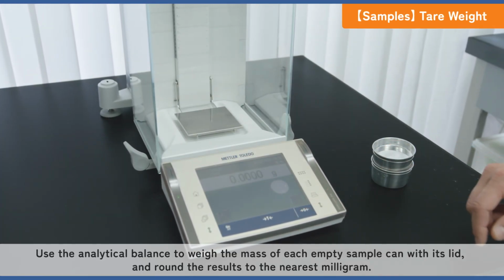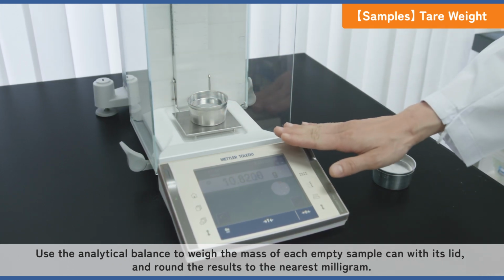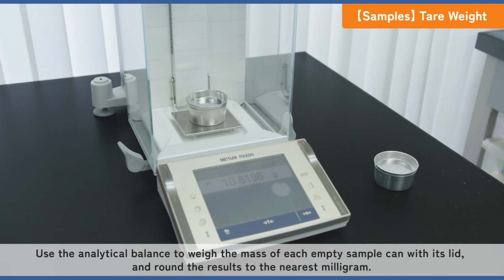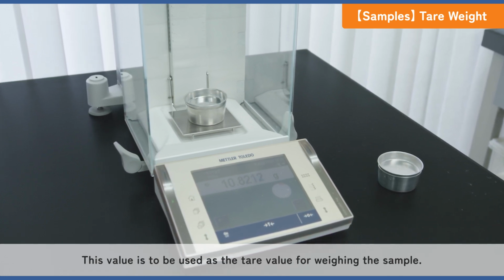Use the analytical balance to weigh the mass of each empty sample can with its lid and round the results to the nearest milligram. This value is to be used as the tare value for weighing the sample.